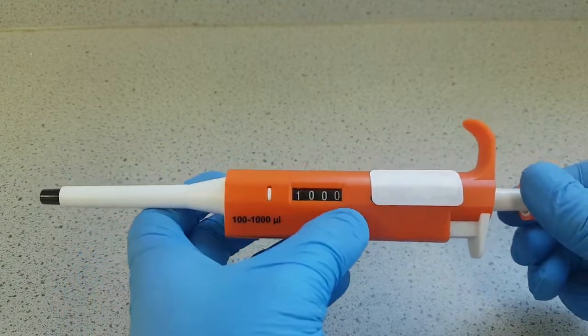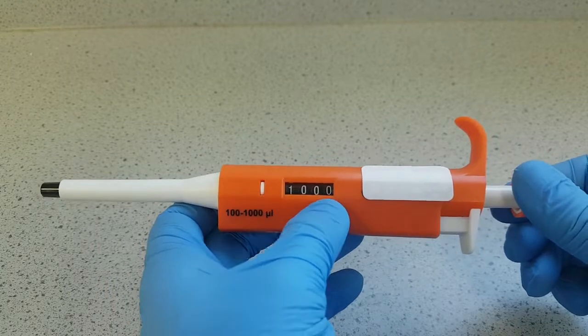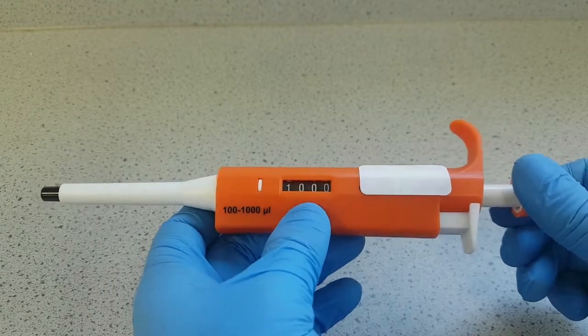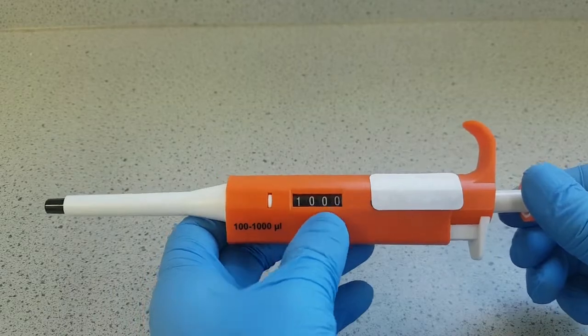This has a four-digit display, but on some displays you'll have a three-digit display, so you might need to multiply or divide your number by a factor of 10.